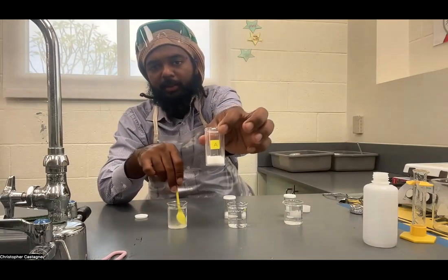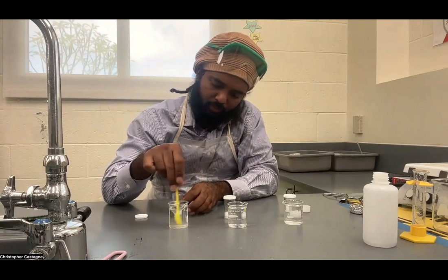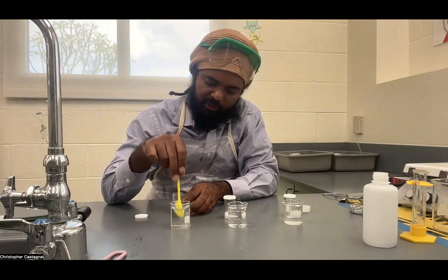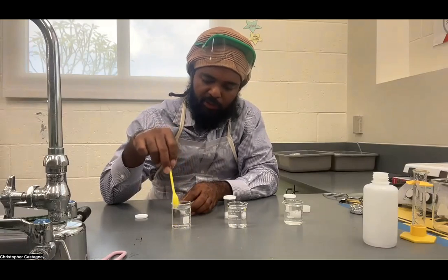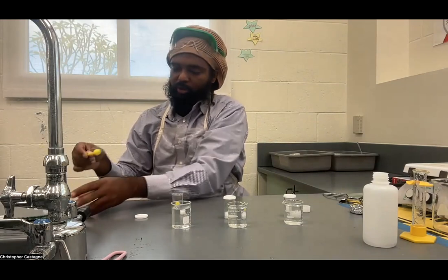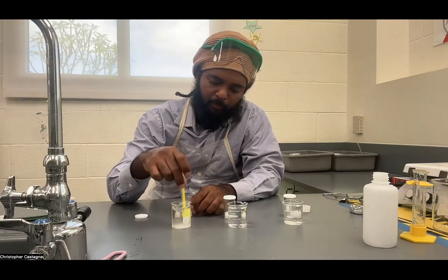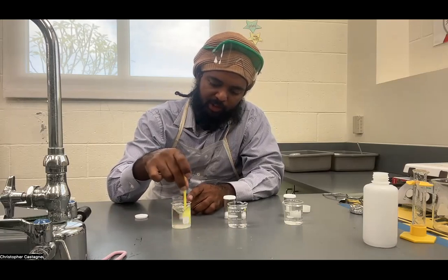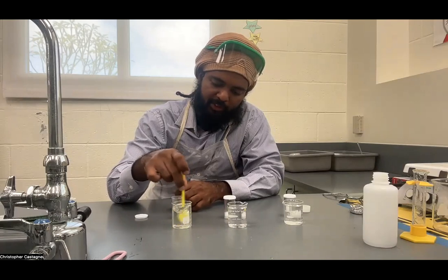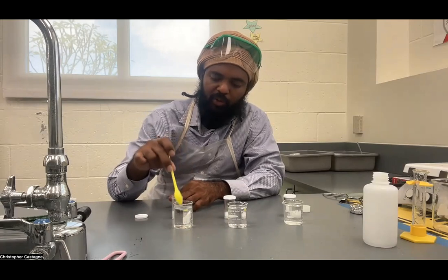In between scoops, I'm going to wipe and dry my spoon to avoid cross-contamination. Scoops is a somewhat subjective measure, and that's why this is more qualitative than quantitative. We've got two scoops dissolved fully, so we know for sure A is soluble. Now, out of ionic, polar covalent, and non-polar covalent, two types of substances dissolve and one does not. The fact that this dissolves is not a definitive test, but it can narrow it down.